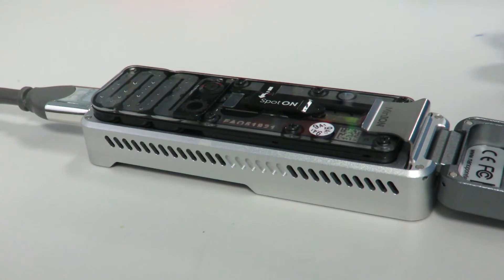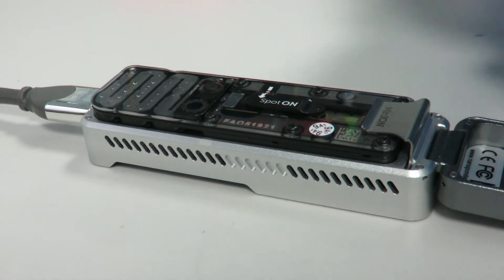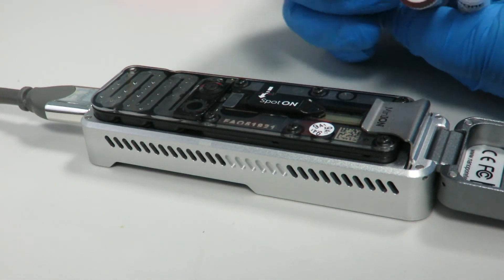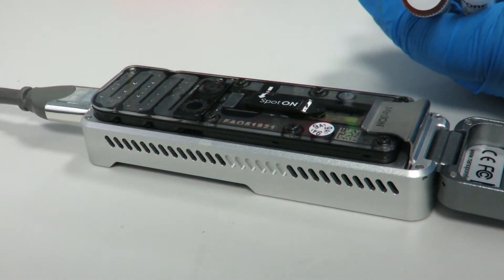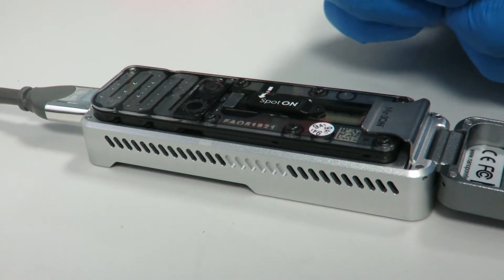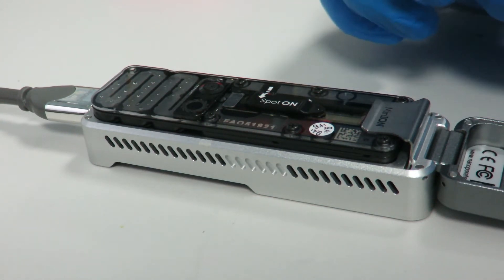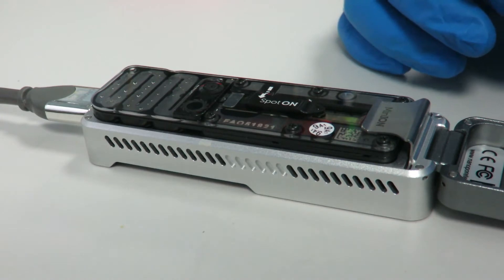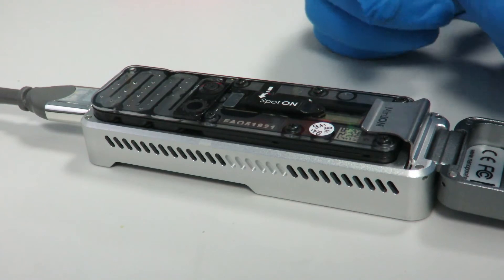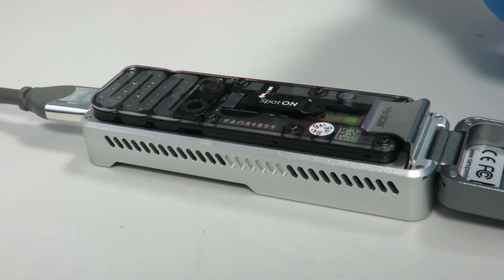You can make up the buffers to clean it, but I think you can only get the storage solution from Nanopore. They all come together in the flow cell wash kit, so you have Buffer A and Buffer B, and then the storage buffer. Buffer A and B is what you add first — that's what cleans the flow cell. It removes DNAs and RNAs and removes your previous sample from the flow cell so that you can start again.